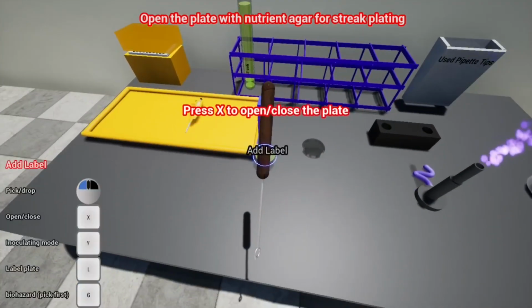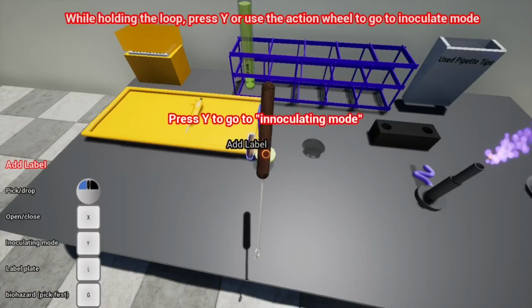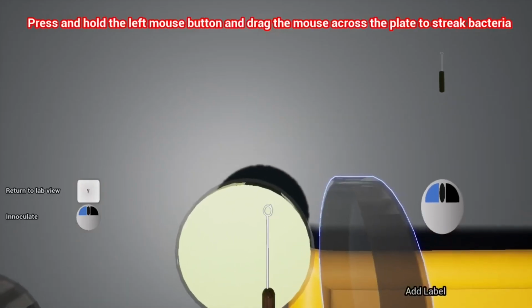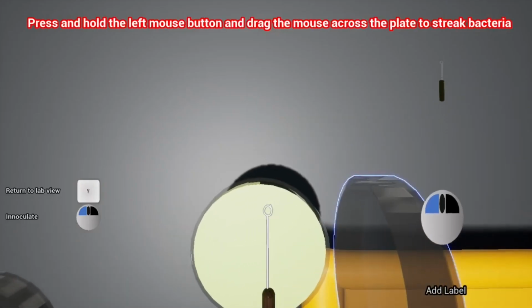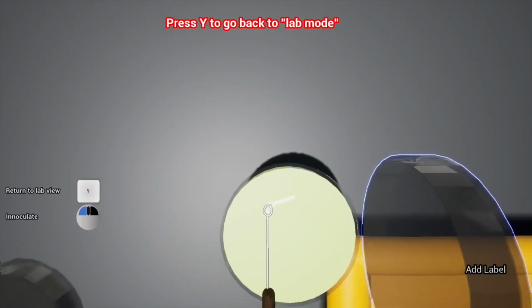So again, point towards the plate, press X. Holding the loop, press Y or use the action wheel to go to inoculate mode. I'm gonna press Y and hold the left mouse button and drag the mouse across the plate to streak bacteria. So this is important. You press and hold the mouse button and drag across.